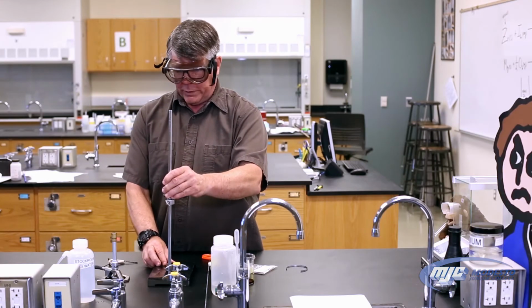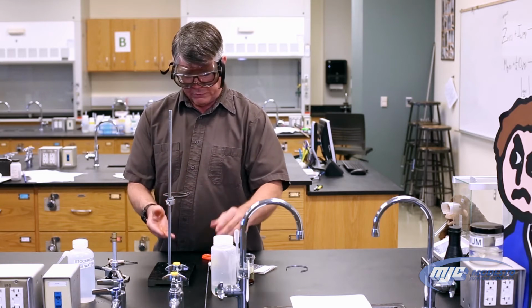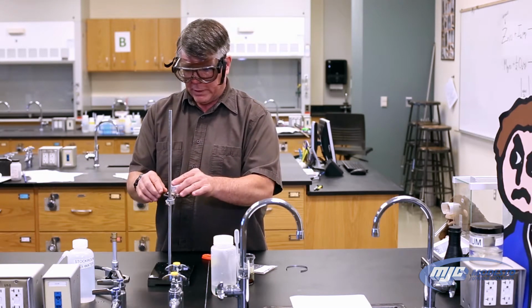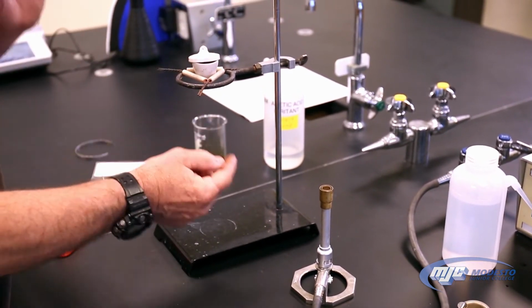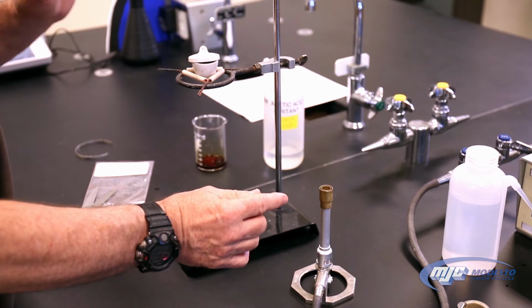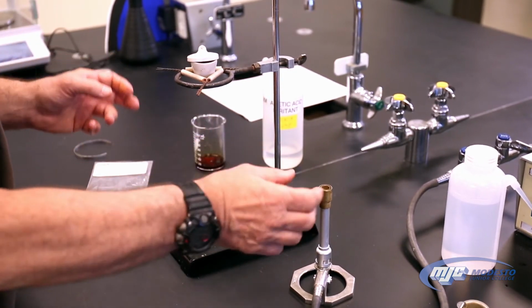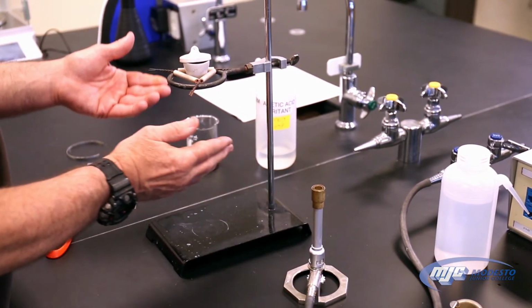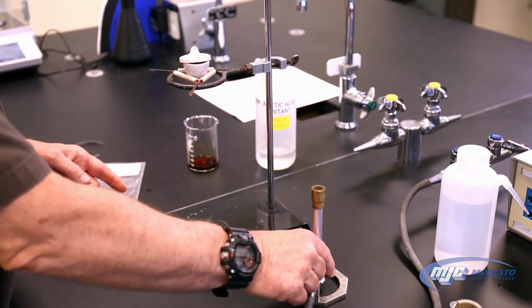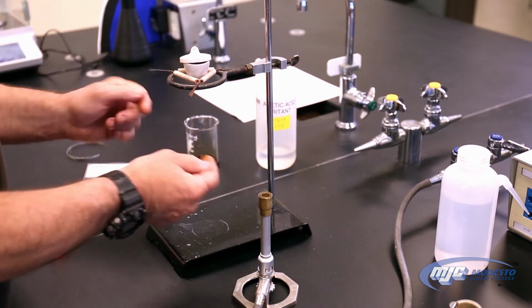First thing we're going to do is light the Bunsen burner before we put it under here, because we need to adjust the height of this. What we need is the hottest part of the flame, which is the tip of the inner bright blue cone, just touching the bottom here. Once it's been there for just a few seconds, this gets really hot, so we don't want to put it under here yet. We're going to light the flame and adjust the height, then put it underneath.